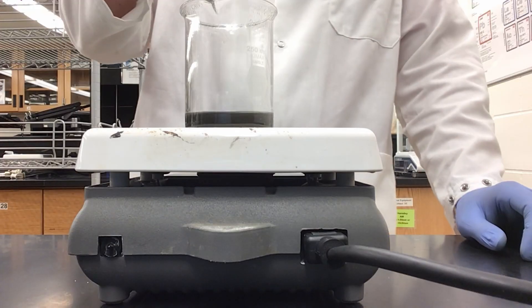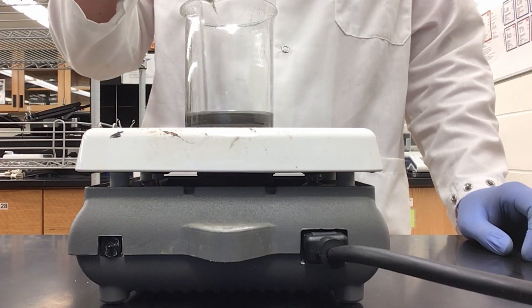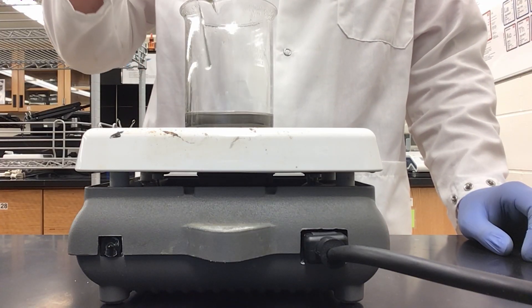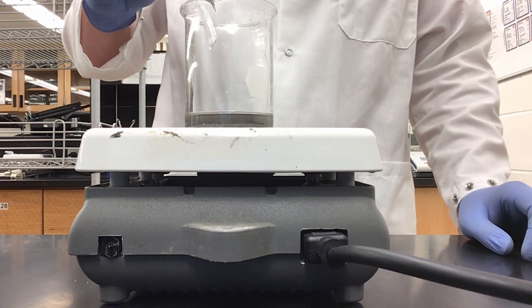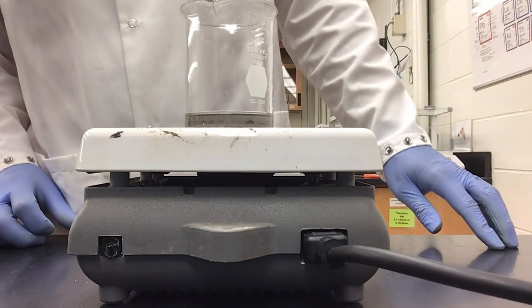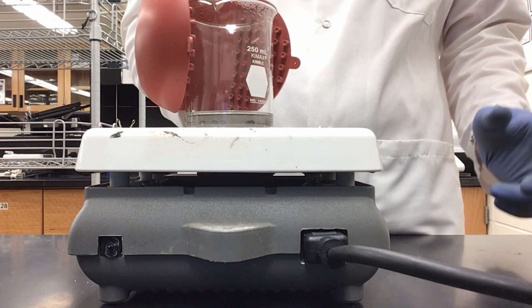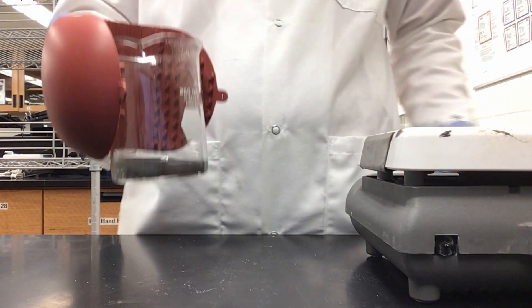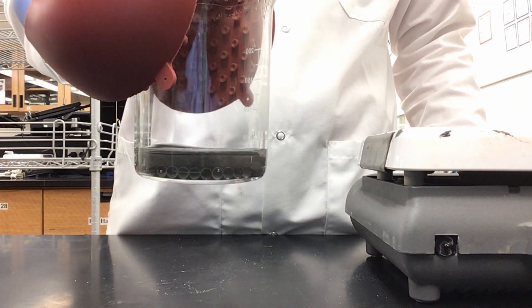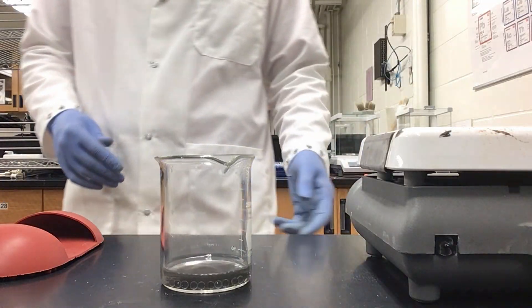I can take and bring in my hot plate again, add my watch glass on top, and slowly heat the solution. Since my solution has been heated, I can remove my watch glass. I am stirring with a glass stir rod to make sure all of my aluminum has reacted. Looking into my beaker, I can see that all of my aluminum has in fact reacted, leaving us with a black powder. So I can take my hot hand protector, remove it from my hot plate, and as you can see, there is a black powder on the bottom of our beaker rather than our silver aluminum.